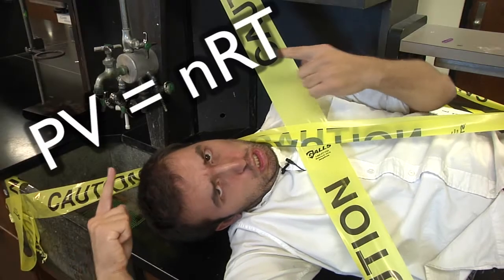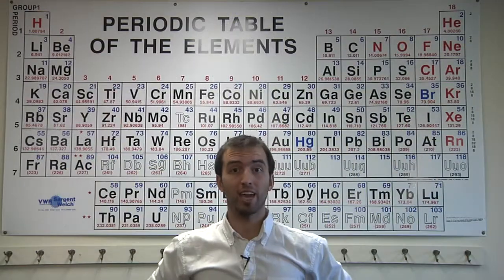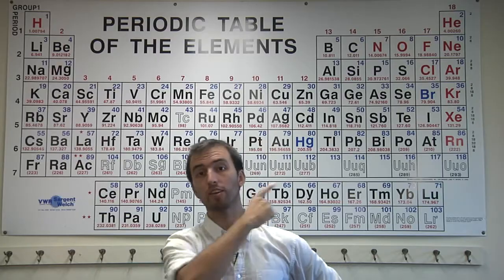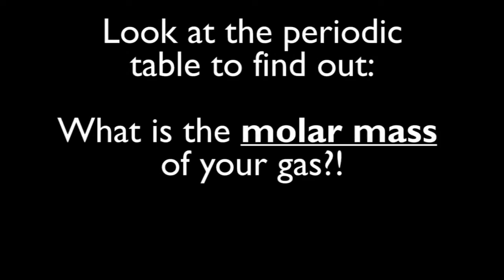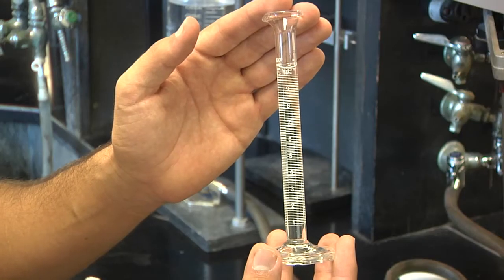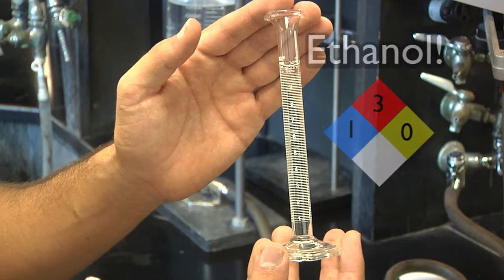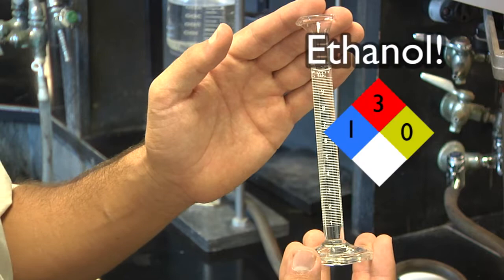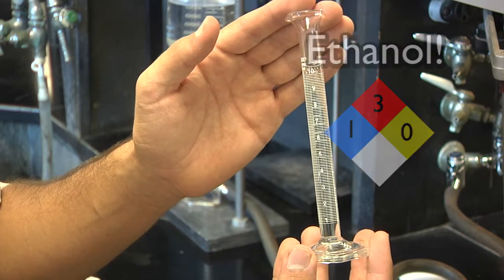Using this equation, and once we know the mass of our gas, we can look on the periodic table. For our volatile liquid, we will be using ethanol because it has a fairly low boiling point and a low level of toxicity.